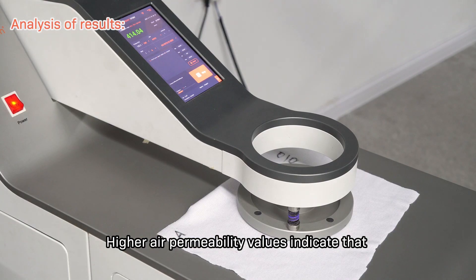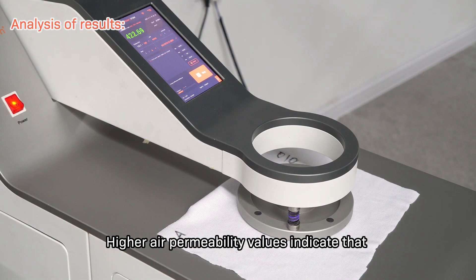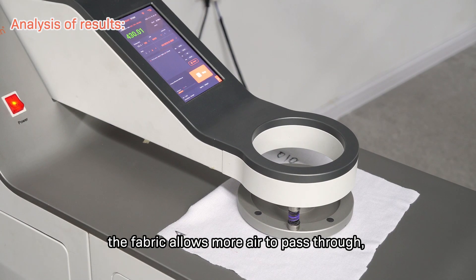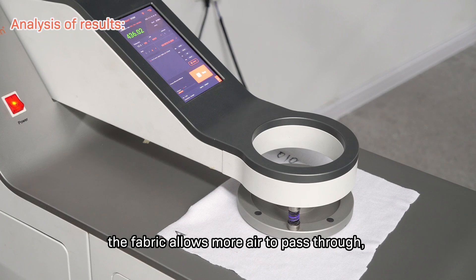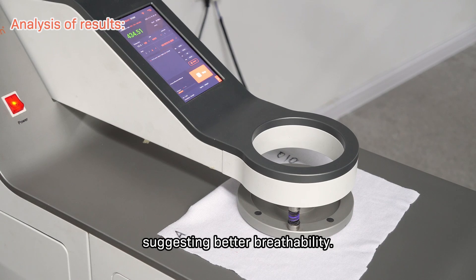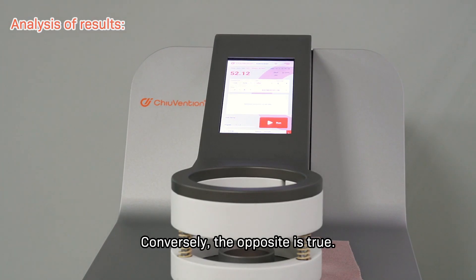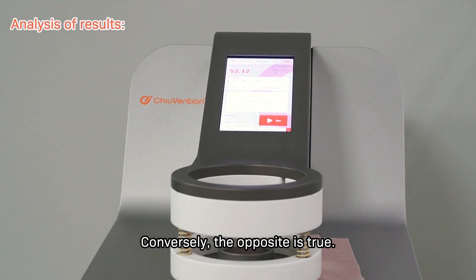Higher air permeability values indicate that the fabric allows more air to pass through, suggesting better breathability. Conversely, the opposite is true.